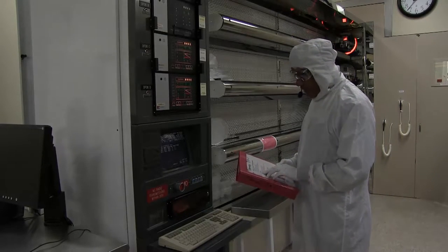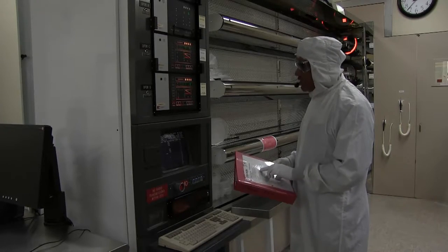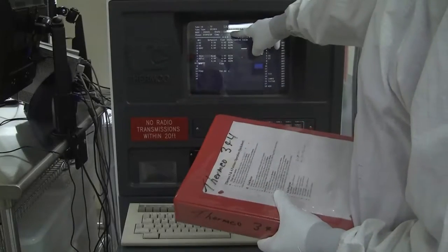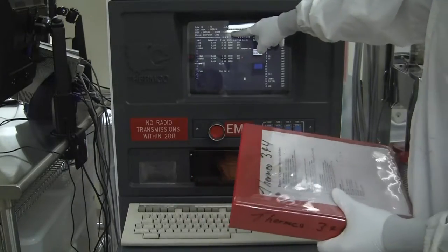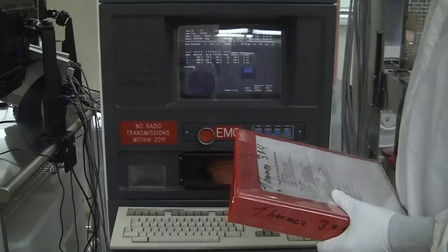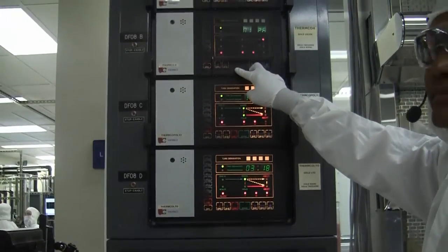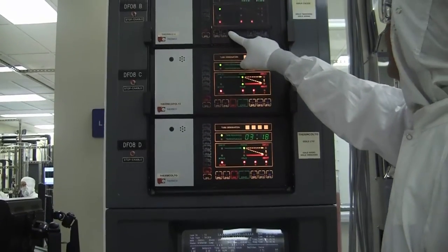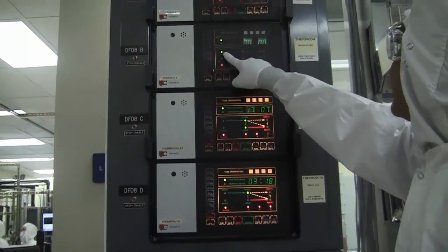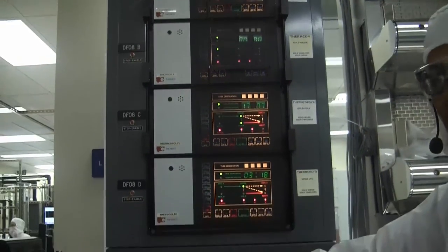Enable the tube. And if the tube is not in standby, press the Stop button until it's in standby. Right now it's complete, but it's not in standby. So we're going to press the Stop button. And now the tube has gone from complete into standby, and down here it says standby as well.